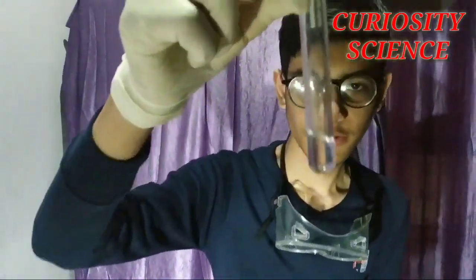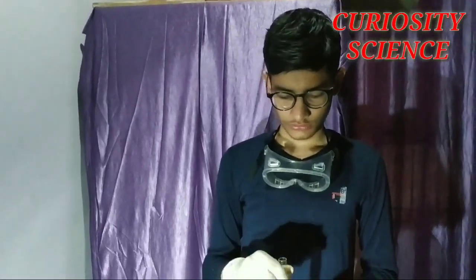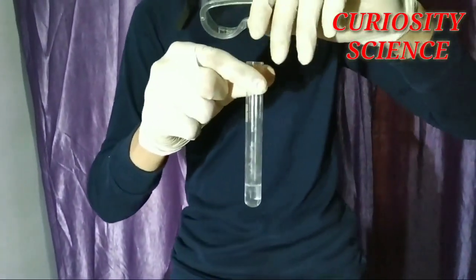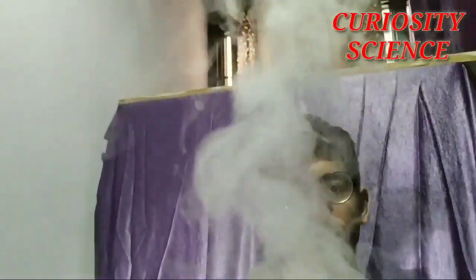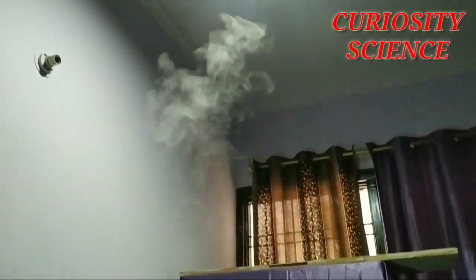The crystal is becoming active — let's go: three, two, one. Oh my god, this solution is very warm!